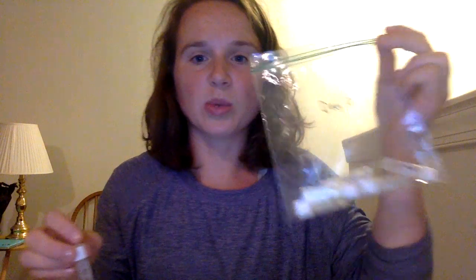Day 0 is just the day number. So there is a 0 on the back of all of these tubes, just so you know that they correlate with day 0. Okay, so you'll be asked to collect the saliva 7 times throughout each day. So the times are immediately after waking up, 15 minutes after waking up, 30 minutes after waking up, 60 minutes after waking up, 3 hours after waking up, 6 hours after waking up, and 9 hours after waking up.